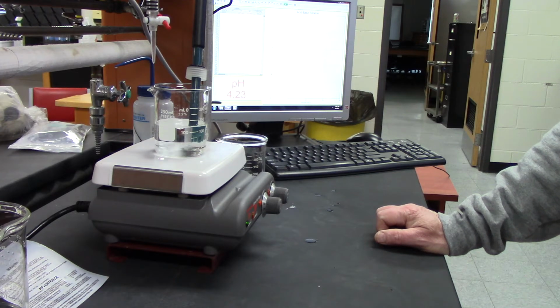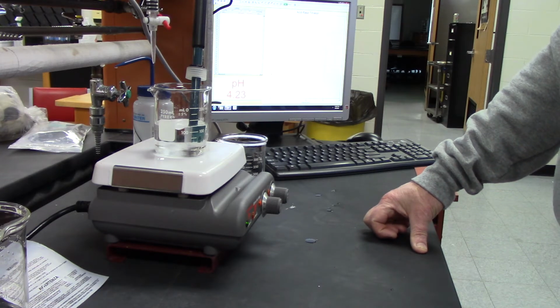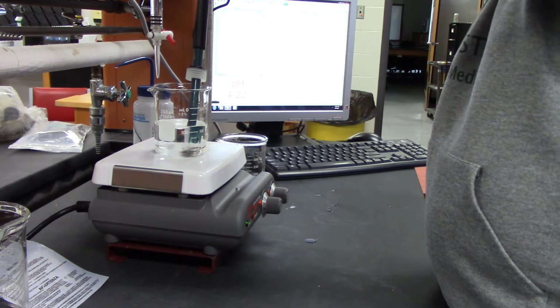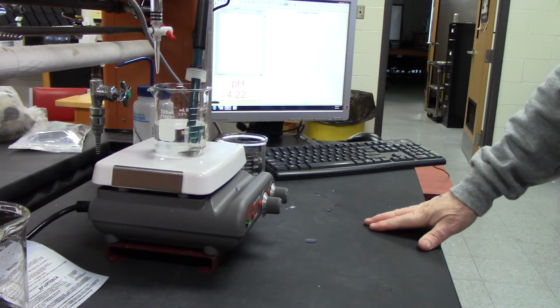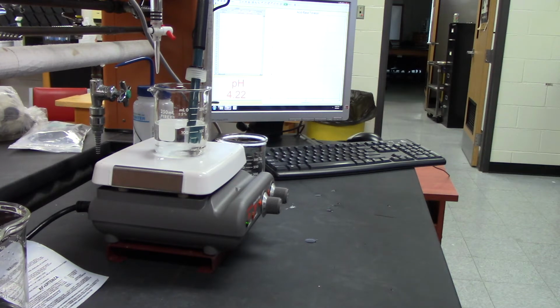So the starting point, okay, is 2 point... Okay, it's kind of hard to read when you're short. 2.5, no, 2.65. 2.65. Remember that. We're going to be writing that down in a second. Okay, you can write it down right now, but we're going to use it in the program in a minute.